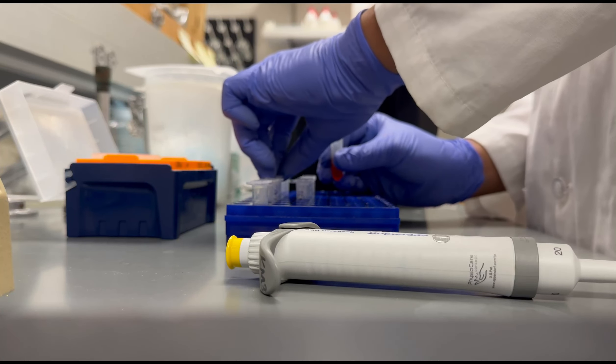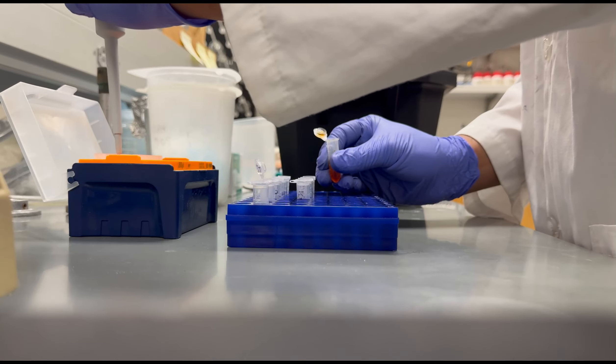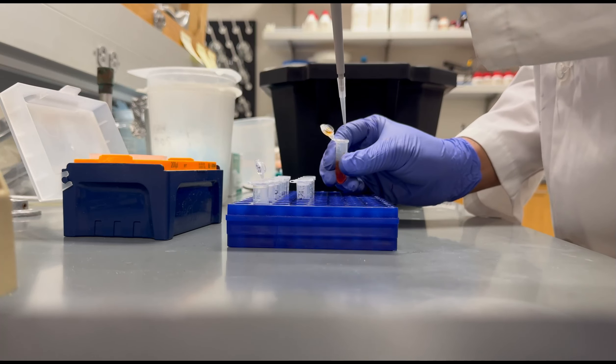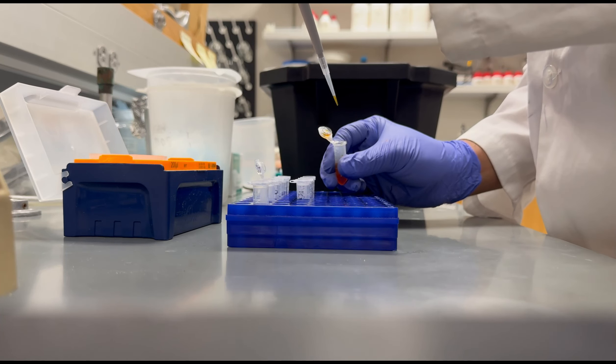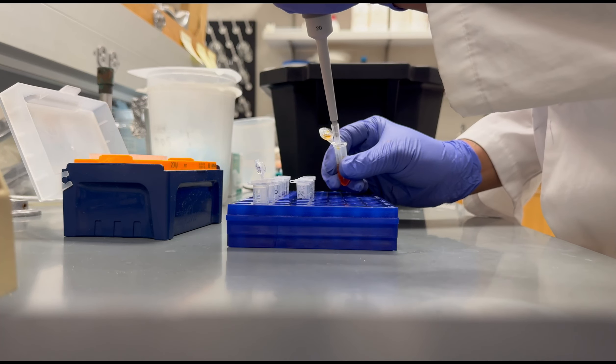During the addition of the 5X loading dye, you will want to ensure that you are using a brand new pipette tip for each of the samples. This is to prevent contamination between samples.